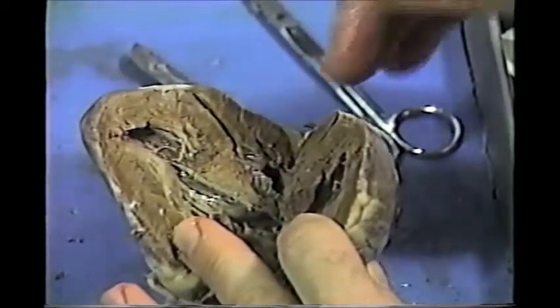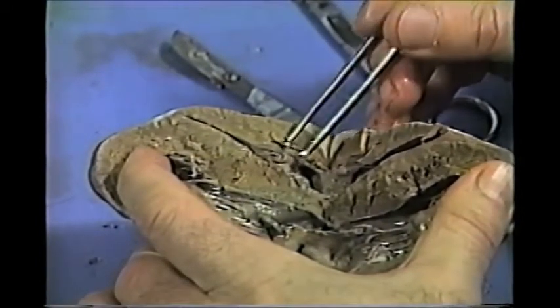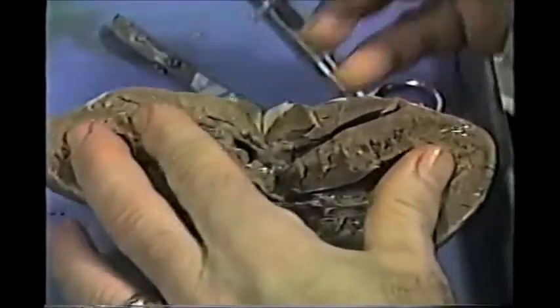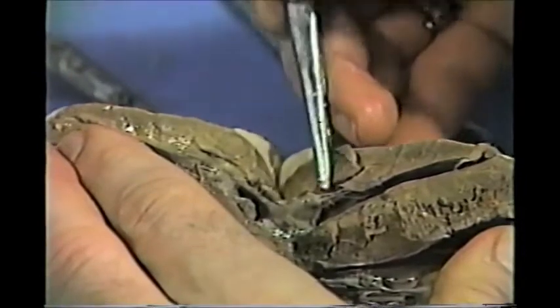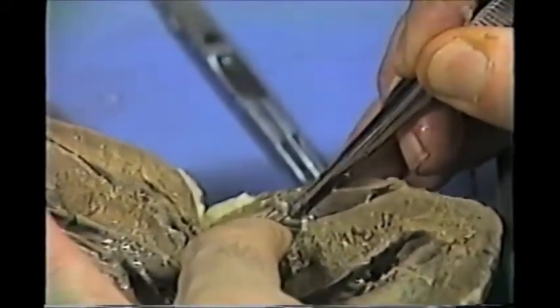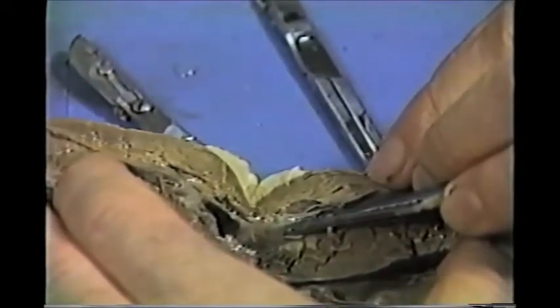There are four one-way valves associated with the heart. If we look on the right side, here is a flap of the AV valve — the atrioventricular valve on the right side — which is called the tricuspid valve. This is one cusp or flap of that valve, this would be another, and here is the third. Attached to the underside of the cusps are these little strings called the chordae tendinae. The other end of these chordae tendinae are attached to bumps of muscle from the ventricle wall called the papillary muscles, and these little bumps right where the forceps are are the papillary muscles. Notice that the chordae tendinae are not very thick and the valve flap is not very thick.